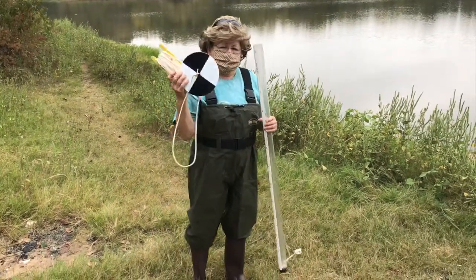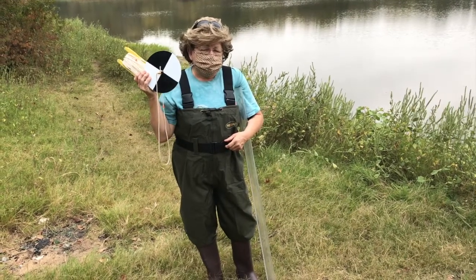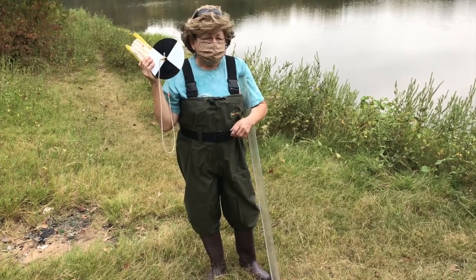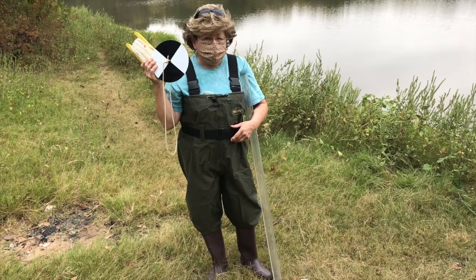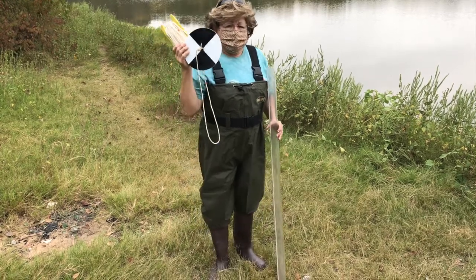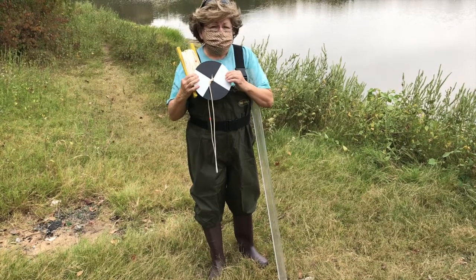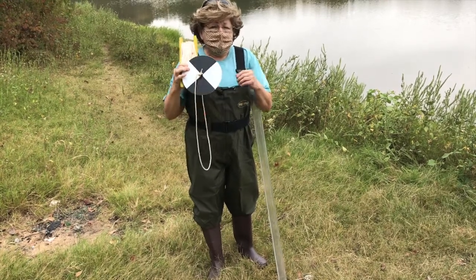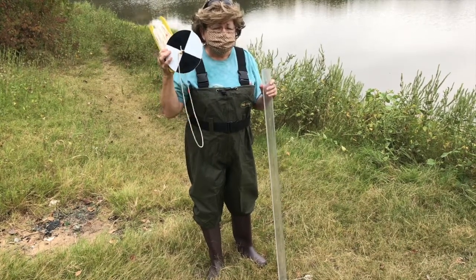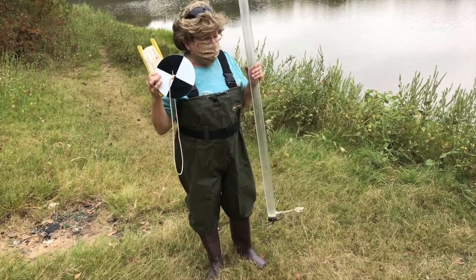Now, this symbol is called a Secchi disc. It was invented by a Catholic priest by the name of Angelo Secchi, and it was invented to measure the cleanliness or clearness of ocean water for the Vatican Navy. At one time, the Vatican had a navy. Now we use this one. It's modified from his. It's 2 black pie pieces and 2 white pie pieces. And when the person looking down into the turbidity tube can see this symbol, we know that that's the clearness of the water. So I'm going to go make a collection now.